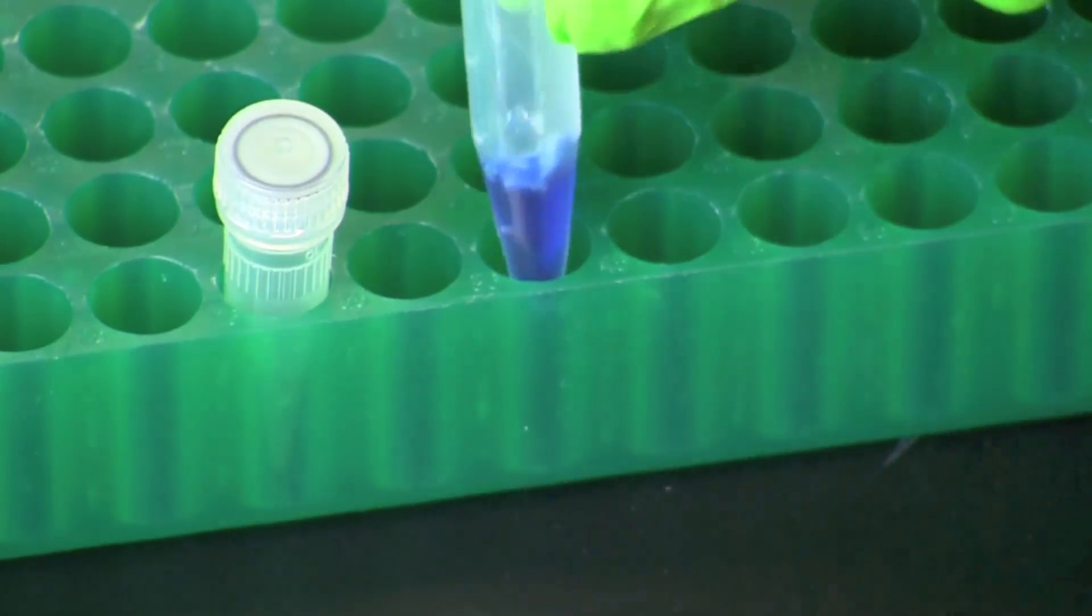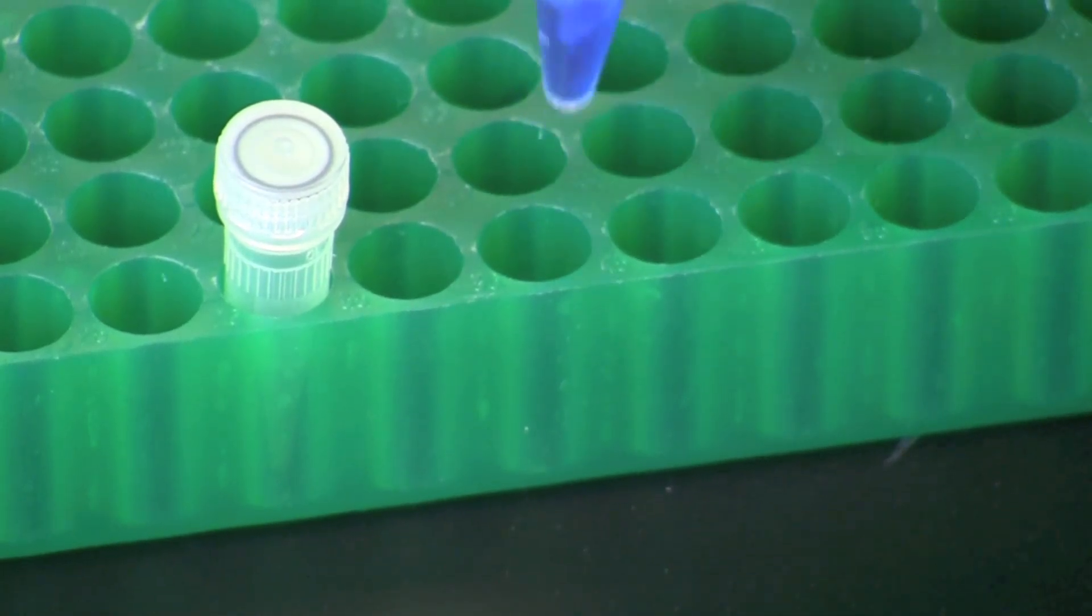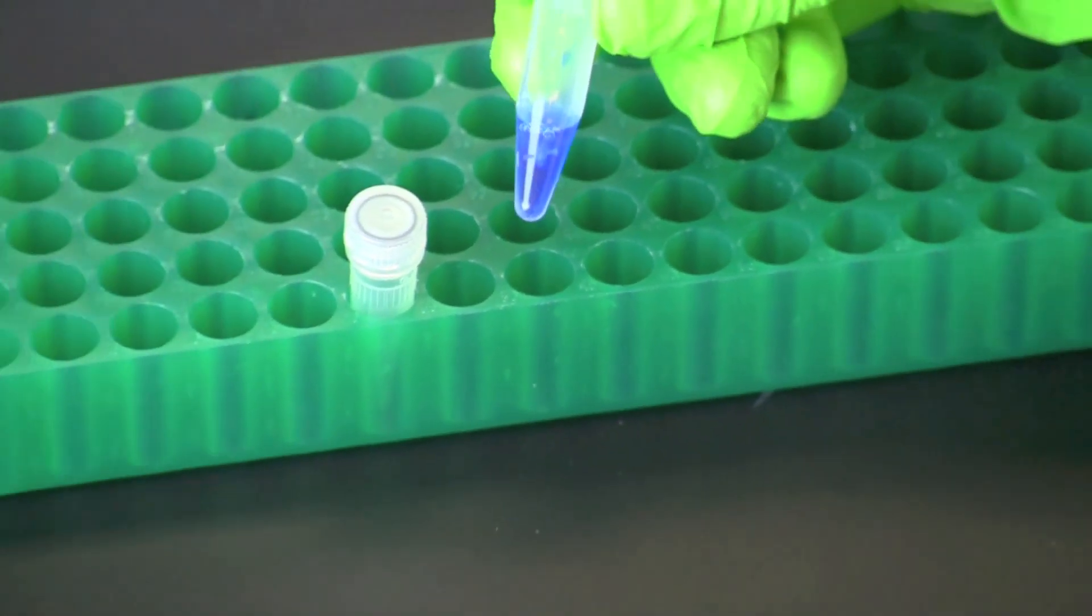Flick or shake the microcentrifuge tube to agitate the fish in the sample buffer, and then incubate the tube for 5 minutes at room temperature.